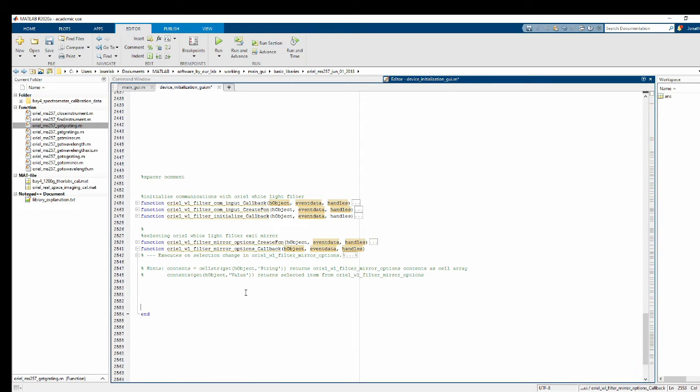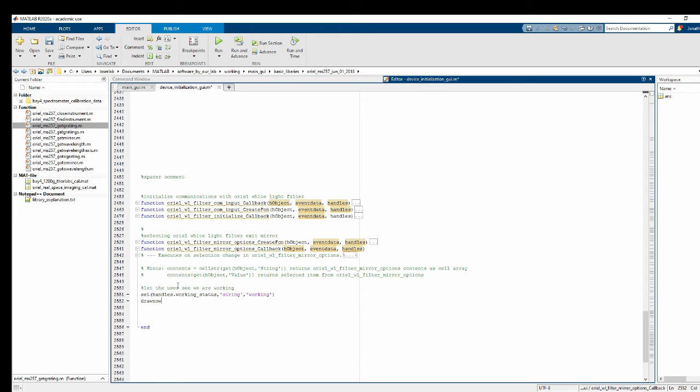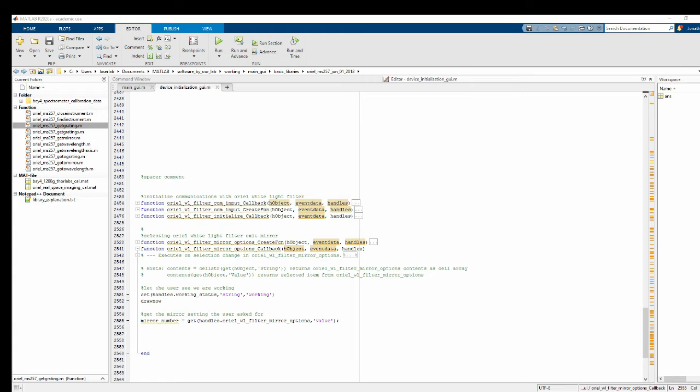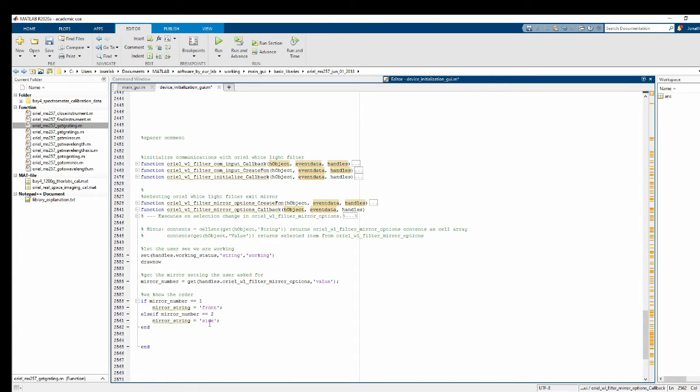Okay. So now what we got to do is first let the user know it's working, because the mirror can take up to 30 seconds to switch. And now what we're going to do is read off which value the user selected. So did they select 1 or 2 basically? And this is sort of hard coded in here, but I know that mirror 1 is front and mirror 2 is side, and those are going to be an input string to my oriel function.